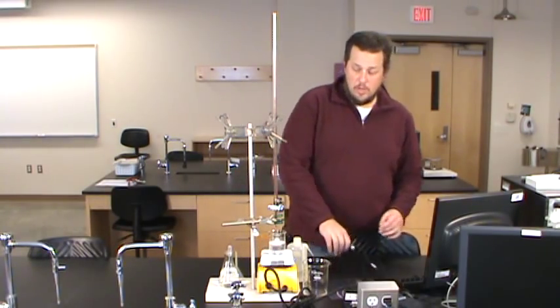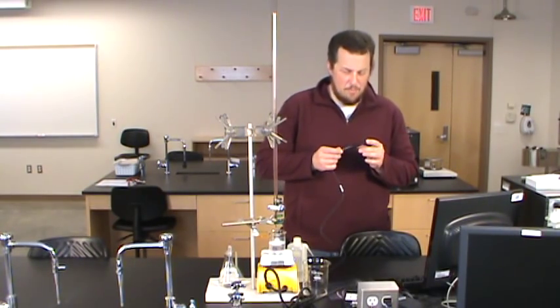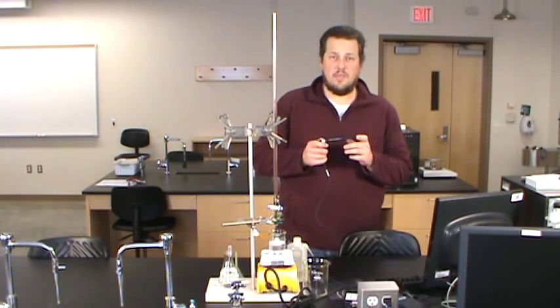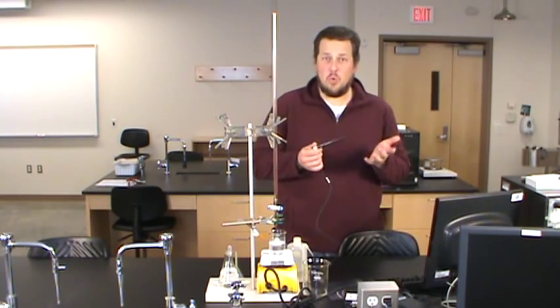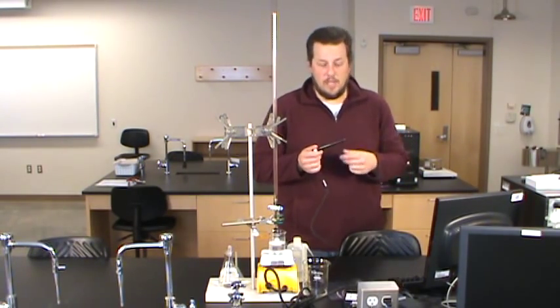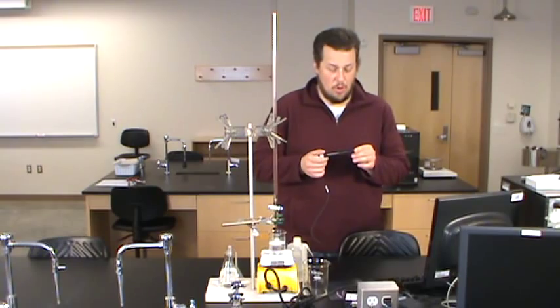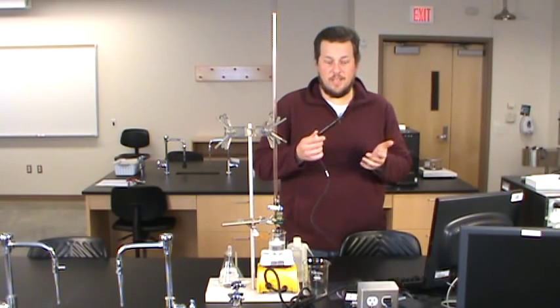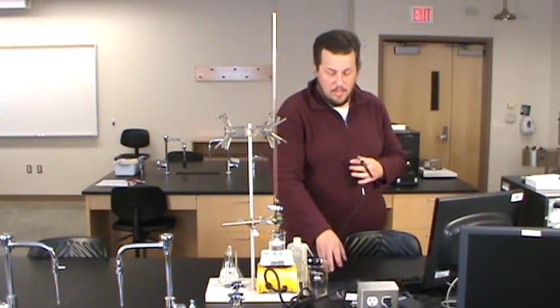What we're going to be using for our experiment is more sophisticated, but in some ways it's really not — the conductivity probes we have in the lab are just a fancy version of two wires dangling down. Instead of measuring the intensity of light from a light bulb, they're actually reading the electric current directly. Functionally, not much different than that.